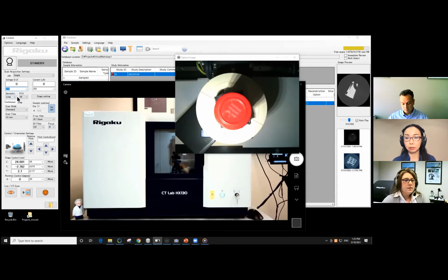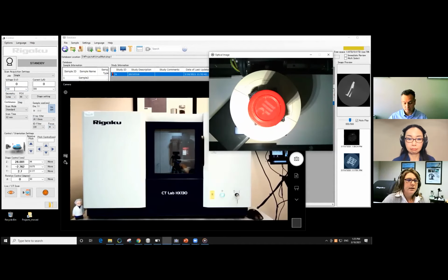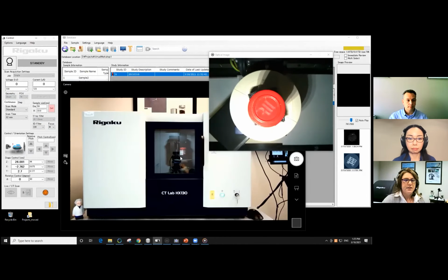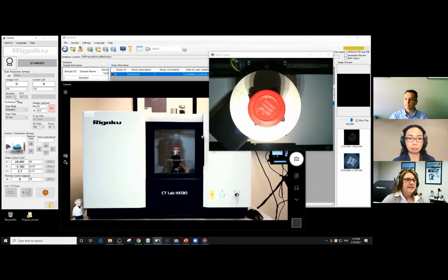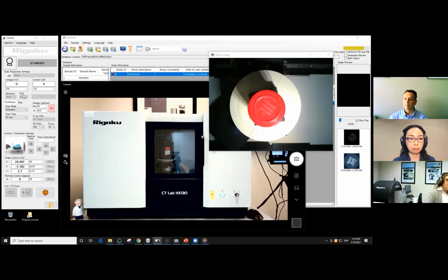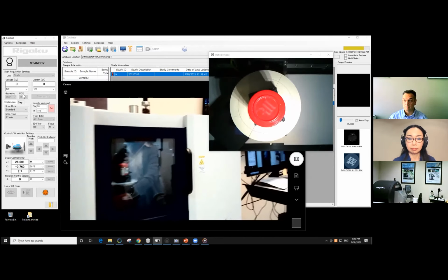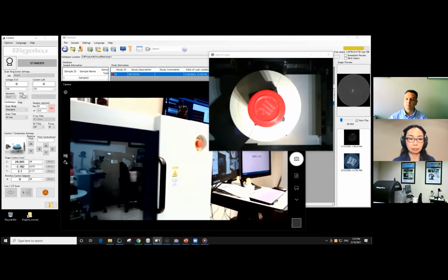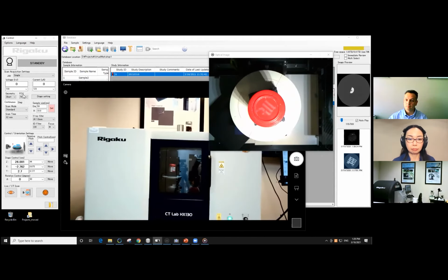You can actually see the stage move. That's right. If I had that out of the way. So it's a little smaller than that. So we could bring everything in a bit closer. In that case, you can change the geometry completely. You'll see everything moving in even closer, and it's going to change to a 70 millimeter field of view. So in this case, the detector is actually moving as well. And we can see that if we look right here, just to convince you that in fact, we can move all of these components.